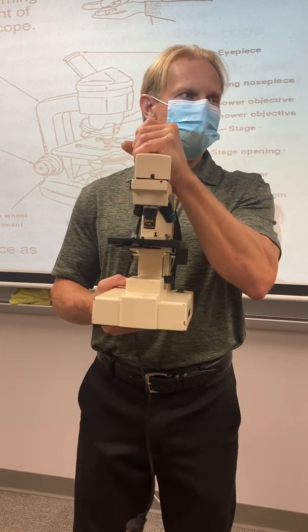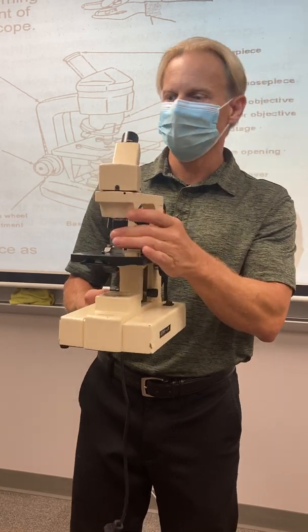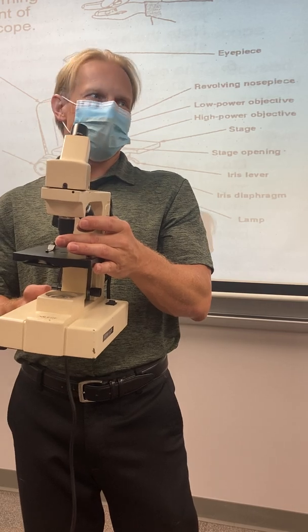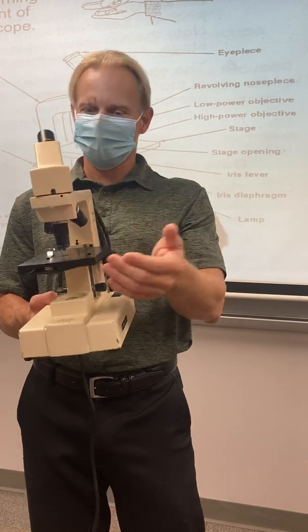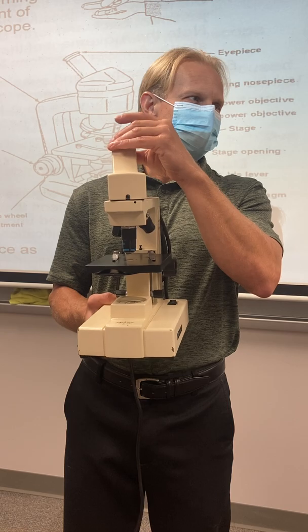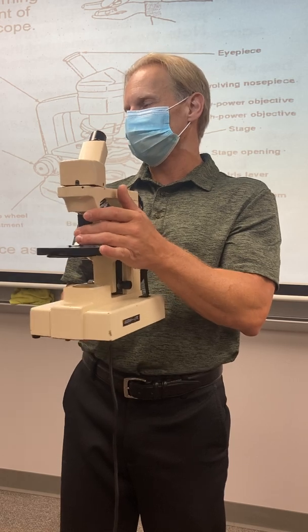You multiply them together. What if I'm on the 40 times down here on this blue one? What is it? 400. It's so easy, add a 0. This one is almost always going to be 10. I think all of our scopes are 10. So it's going to be 10 times whatever this is. But they can be different, so you might check. Okay, so we're figuring out magnification. It's this times whatever this is. So this can look at 400 times normal size.